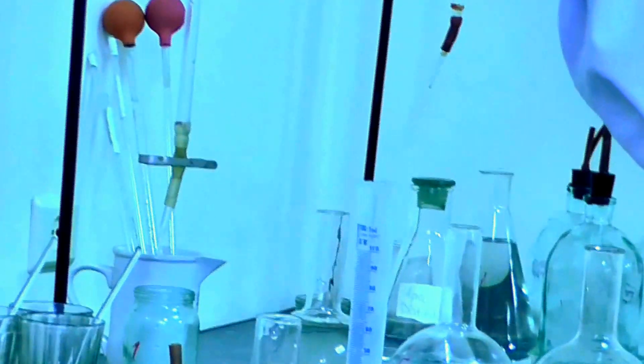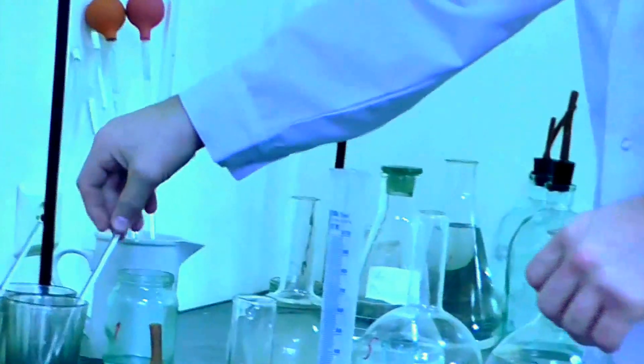Now we will wait 10 minutes. Stirring in solution.